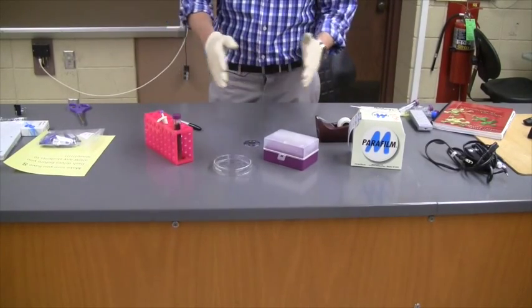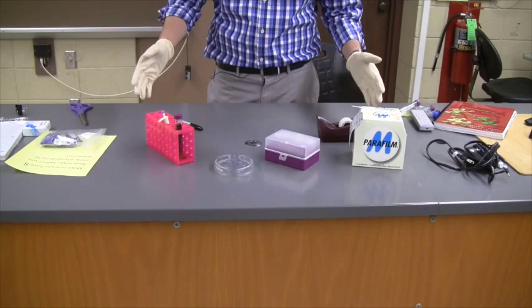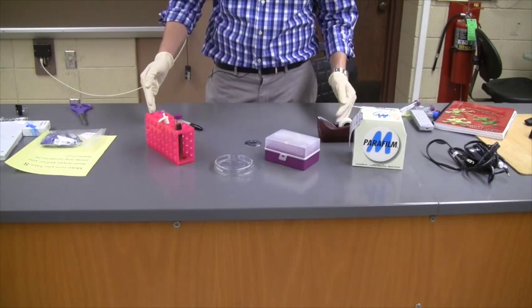Hey there, biology student. I've got all the material here today to help you inoculate your agar plate for this week's investigation.